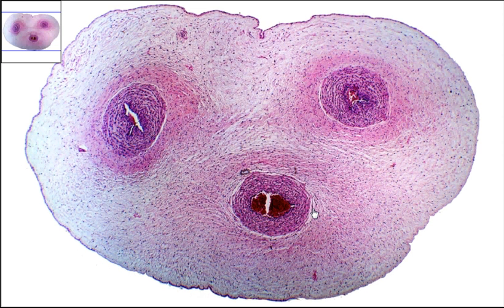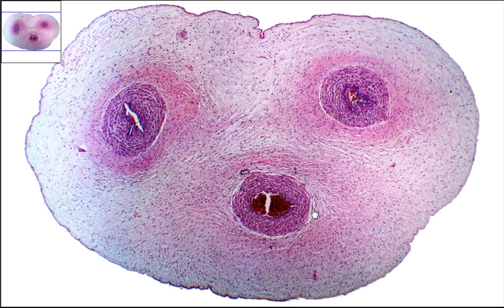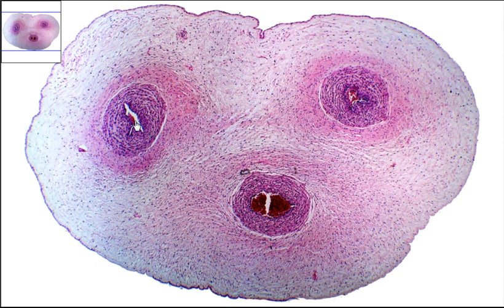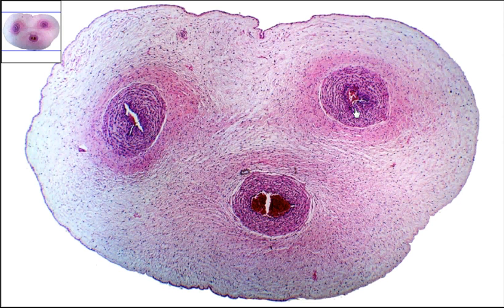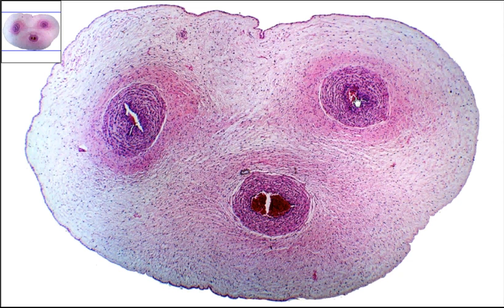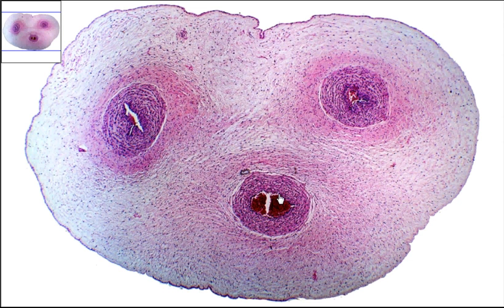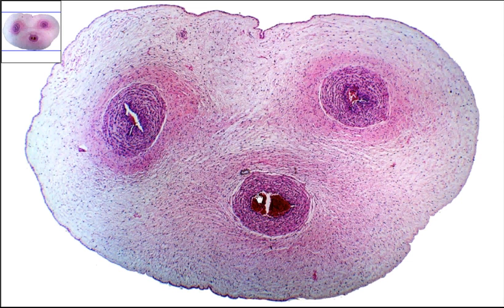You can tell the difference by the size of the lumen. The lumen is the open space where the blood flows. The arteries have smaller lumens, while the vein down here has a larger, more open lumen, or open white space.